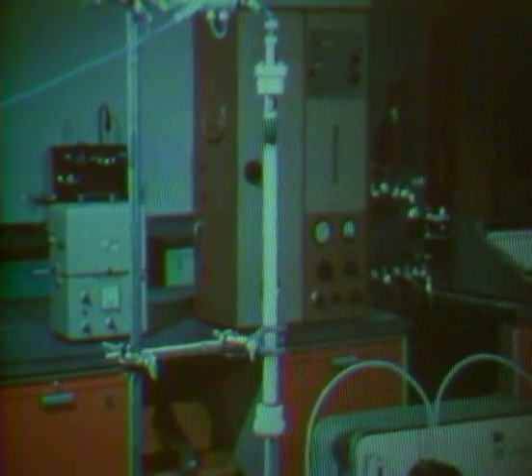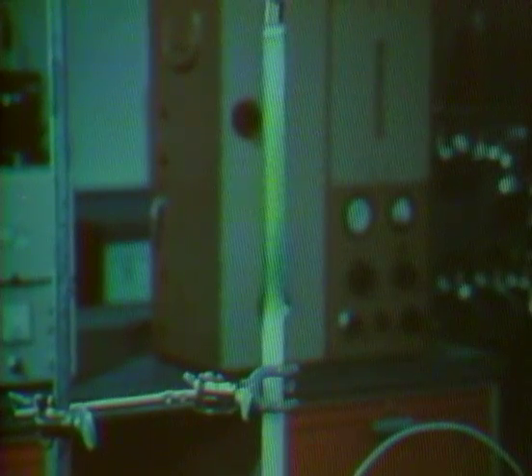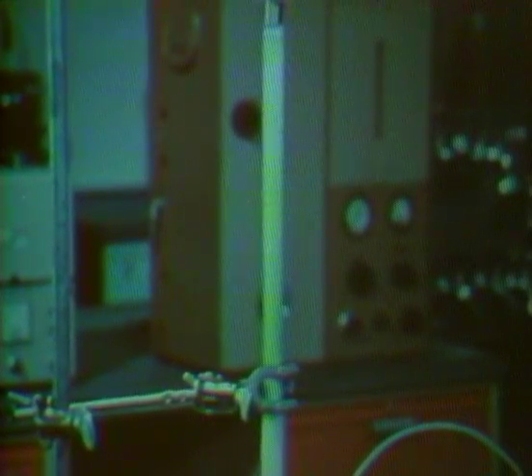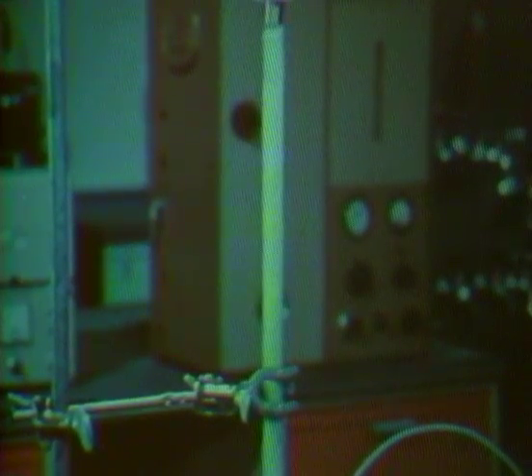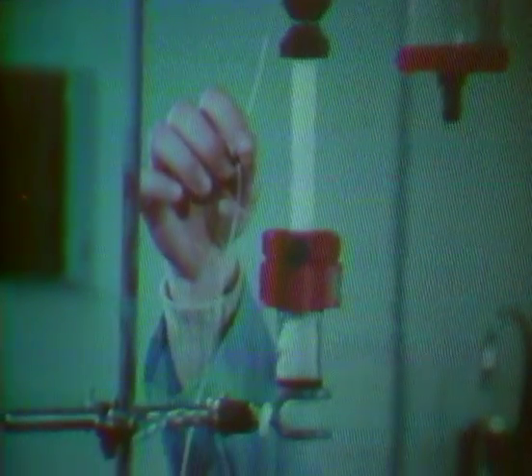As it equilibrates between the mobile phase and the solid adsorbent, the pigments are separated into individual bands. If the same sample were separated on a different stationary phase, a different separation would occur. In some liquid chromatographic systems, the liquid phase flows from a reservoir through a tube into the base of the column and then upward through the column. The separated components may be collected in individual containers for subsequent identification.